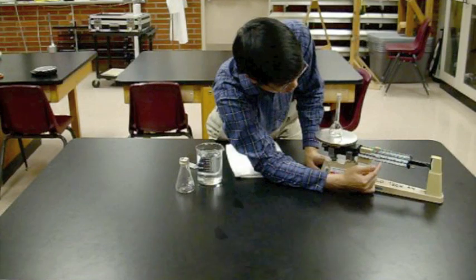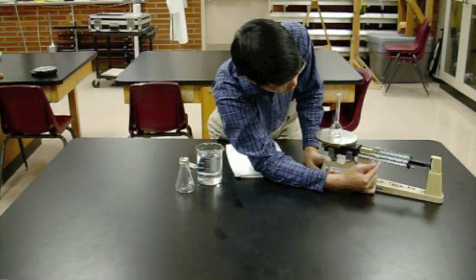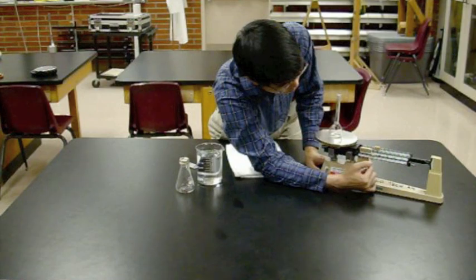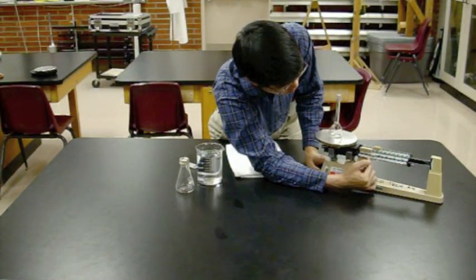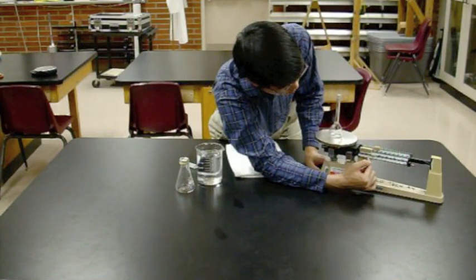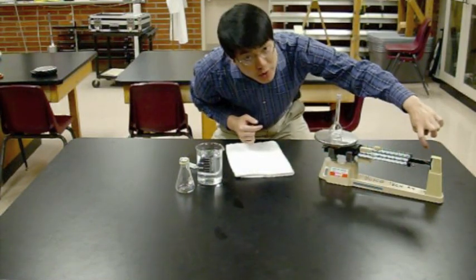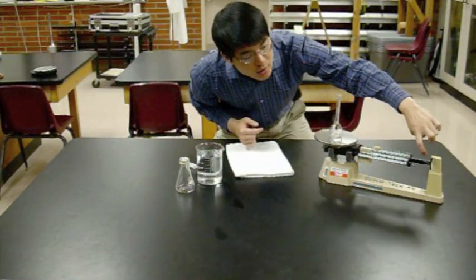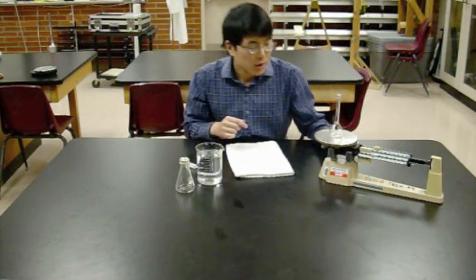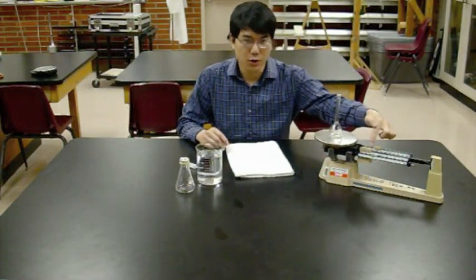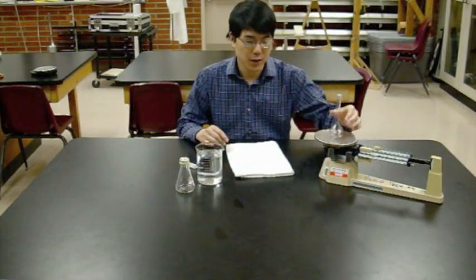And that's still a little too much. You want the little white line here to line up with the dot on the triple beam balance. And that will be the mass of the volumetric flask. Add up the numbers on all three sliders, and you'll get your mass.